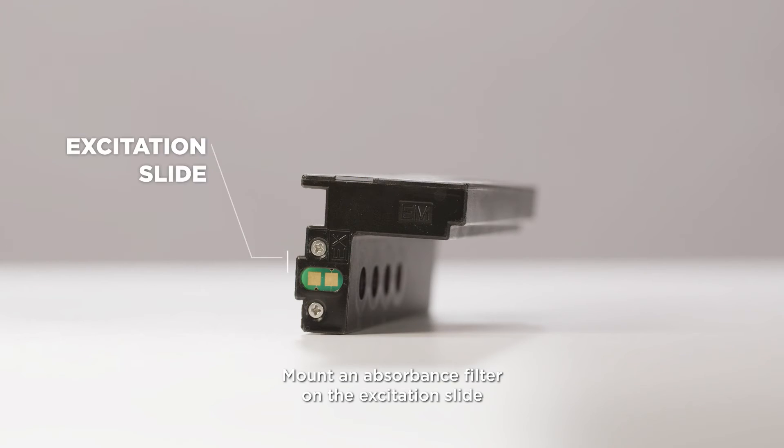Mount an absorbance filter on the excitation slide, taking the orientation of the filters concerning the light path into account as described previously.